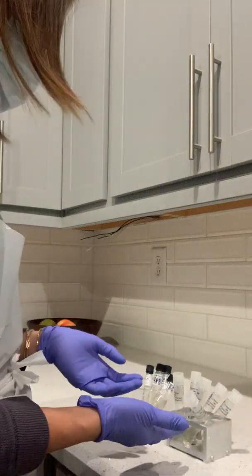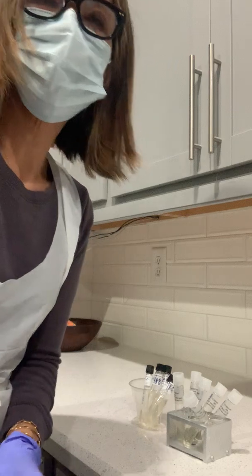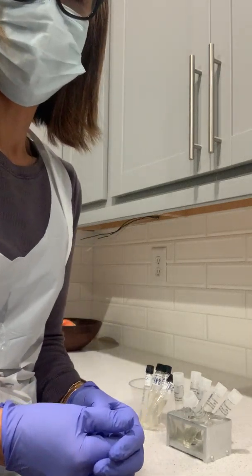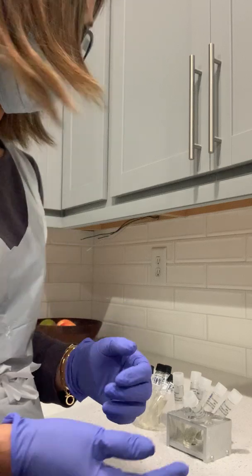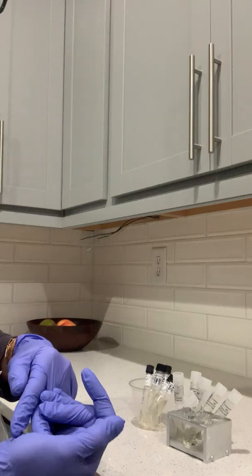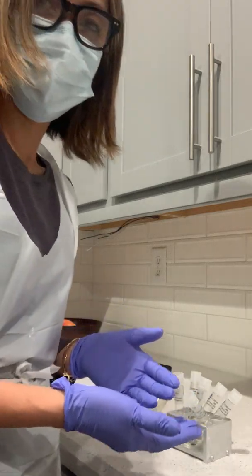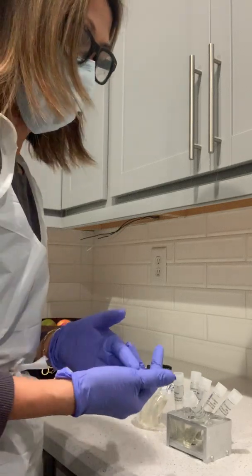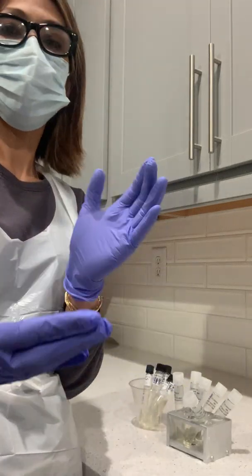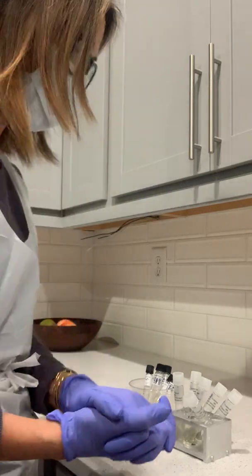So I have my specimen, or my broth here, that actually incubated for more than 48 hours. Today I will be showing you the results for both tests, since it's easier to show both, the outcome of my testing for both the salt and the pH.